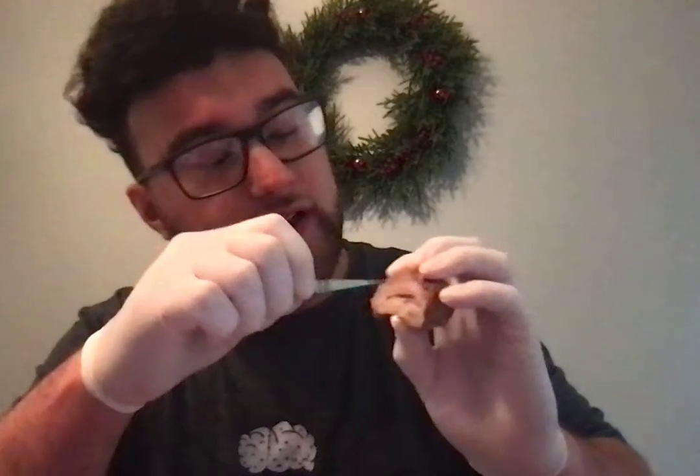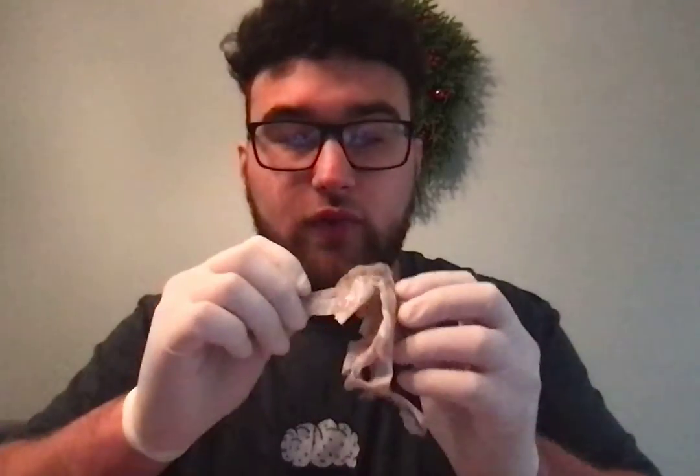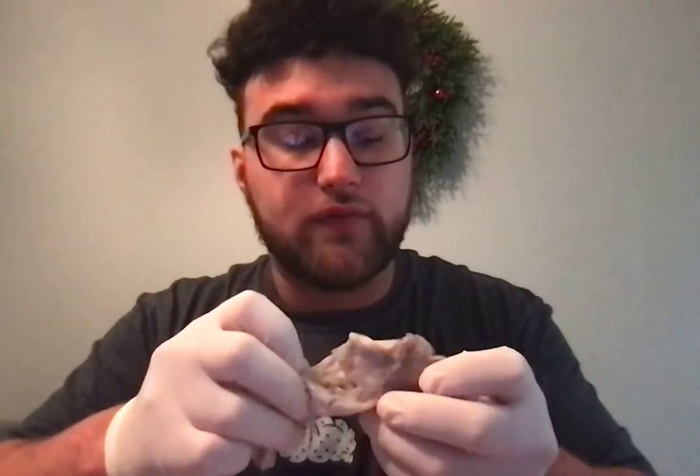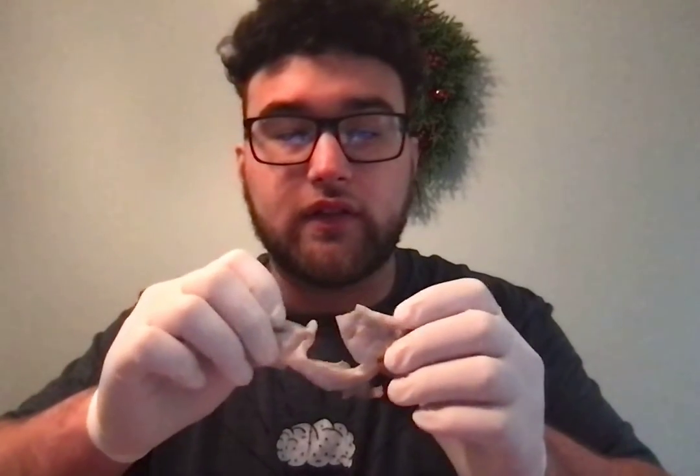Now, the white matter is any part of the brain that is white inside. You have the gray matter, which is darker, and then the white matter, which are the white spots inside the brain. And the meninges is the membrane that surrounds the brain. I had cut it off to examine it, but it is the coating that surrounds and protects the brain.